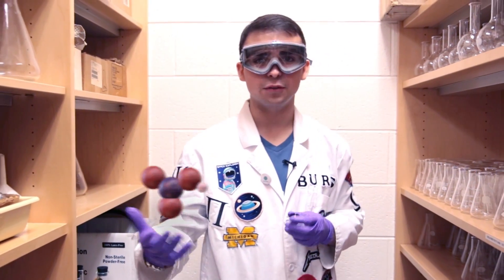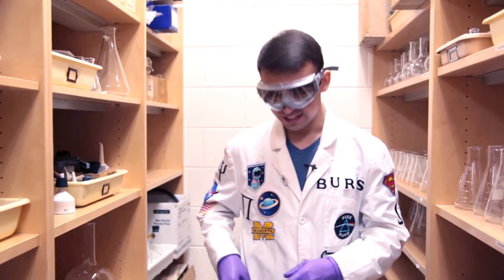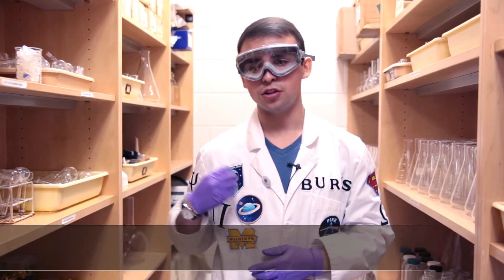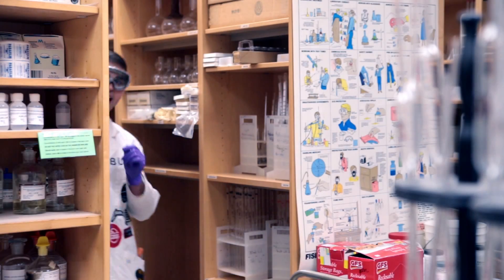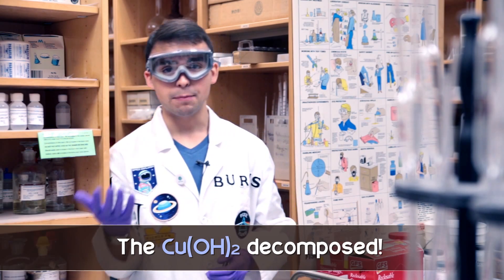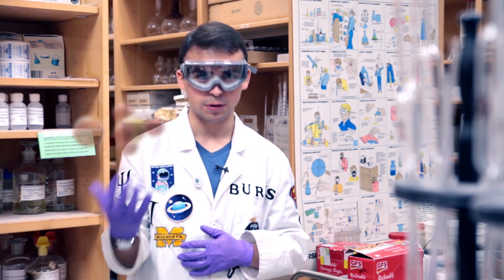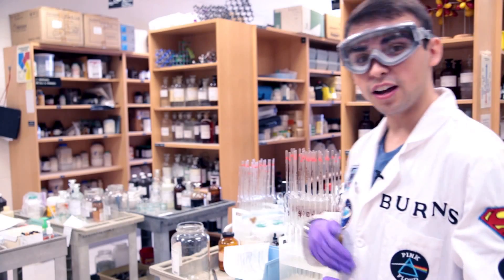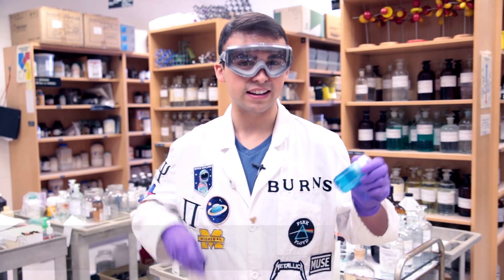First, with nitric acid, we took copper metal and we ionized it into copper two ions. The deadly brown gas nitrogen dioxide was formed. With addition of sodium hydroxide, we formed copper hydroxide, a solid. After heating, we were left with water and copper oxide. We then added in sulfuric acid and we had a copper sulfate solution. Finally, with the addition of zinc metal, we were able to reduce our copper two ion back into copper metal.